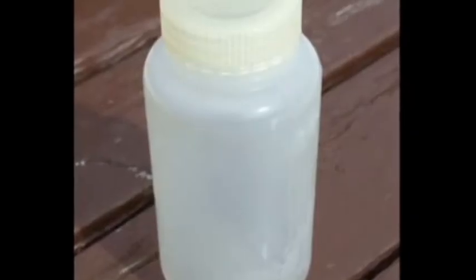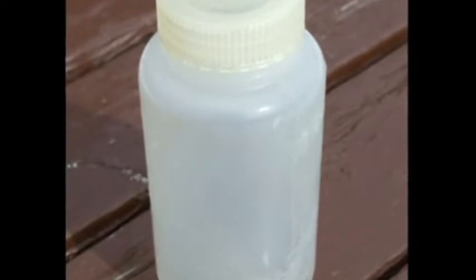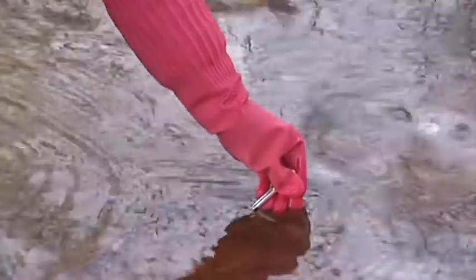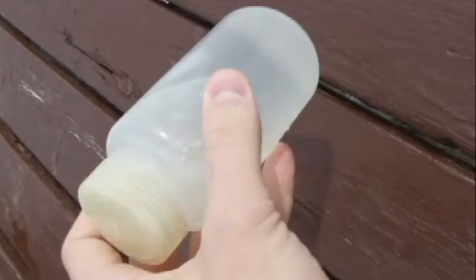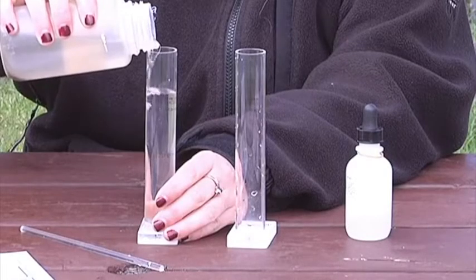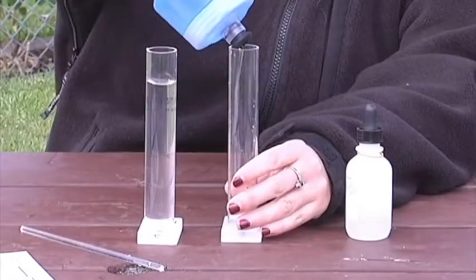This would require a clean container that can hold 200 milliliters of water. If you use this method, measure dissolved oxygen and temperature immediately. For the other parameters, gently mix the water in the container before making the measurement. If you decide to take separate water samples for each parameter, start by measuring turbidity.